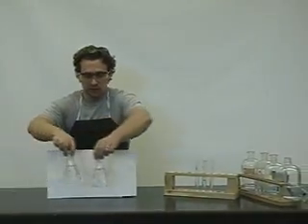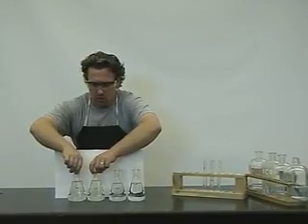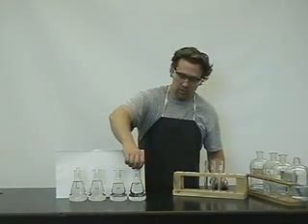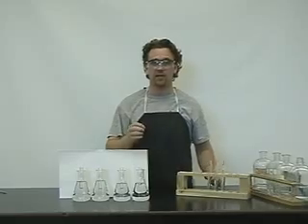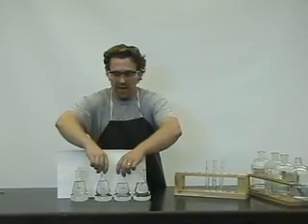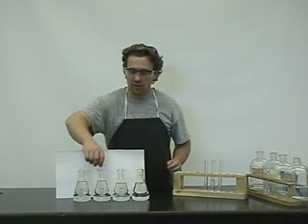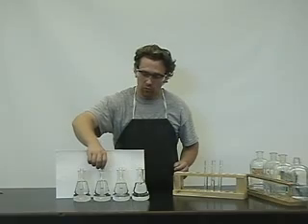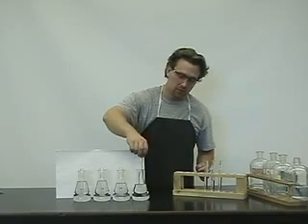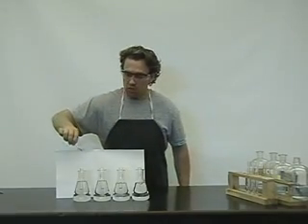In part three, we're going to discuss the varying effects of temperature on a reaction rate. The question to be asked is: how does temperature affect the reaction rate? We've prepared four baths with varying temperatures. The first bath being at zero degrees Celsius, the second bath at room temperature, 23 degrees Celsius, the third bath at 50 degrees Celsius, and the fourth bath at 90 degrees Celsius. We will add a one centimeter strip of magnesium to each of the test tubes.